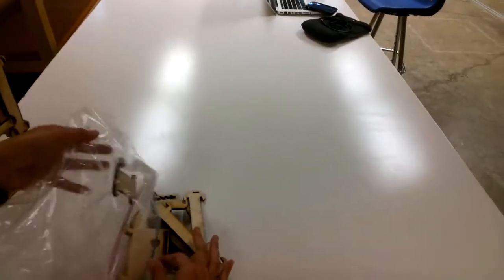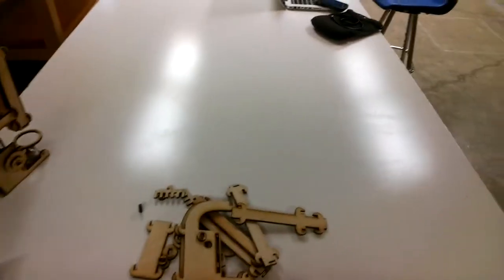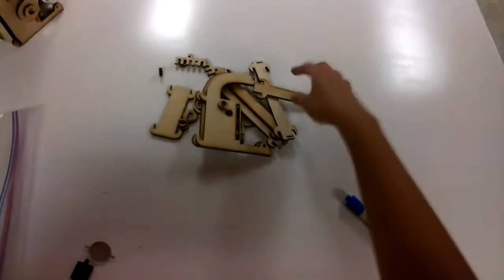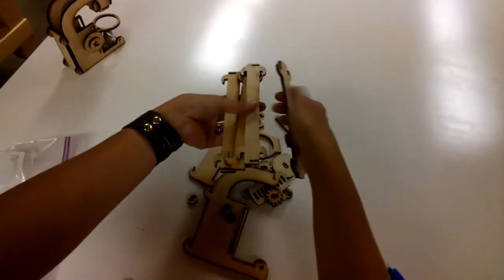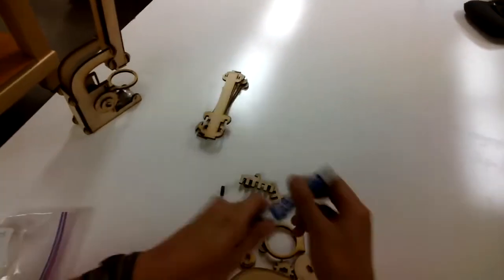So the first thing you're going to do is dump out all the parts from your kit. Don't let any of them roll off the table like that. And then we're going to sort out all the parts. So first, look for 4 long pieces. They look like these. This is going to be the tube of your microscope.